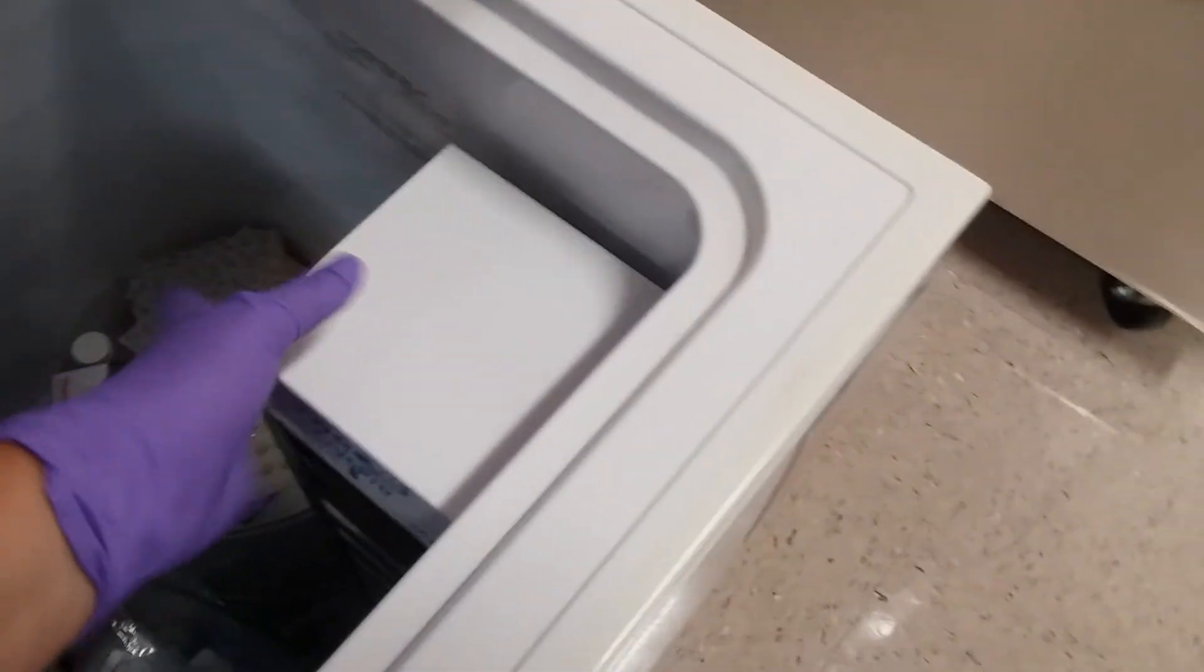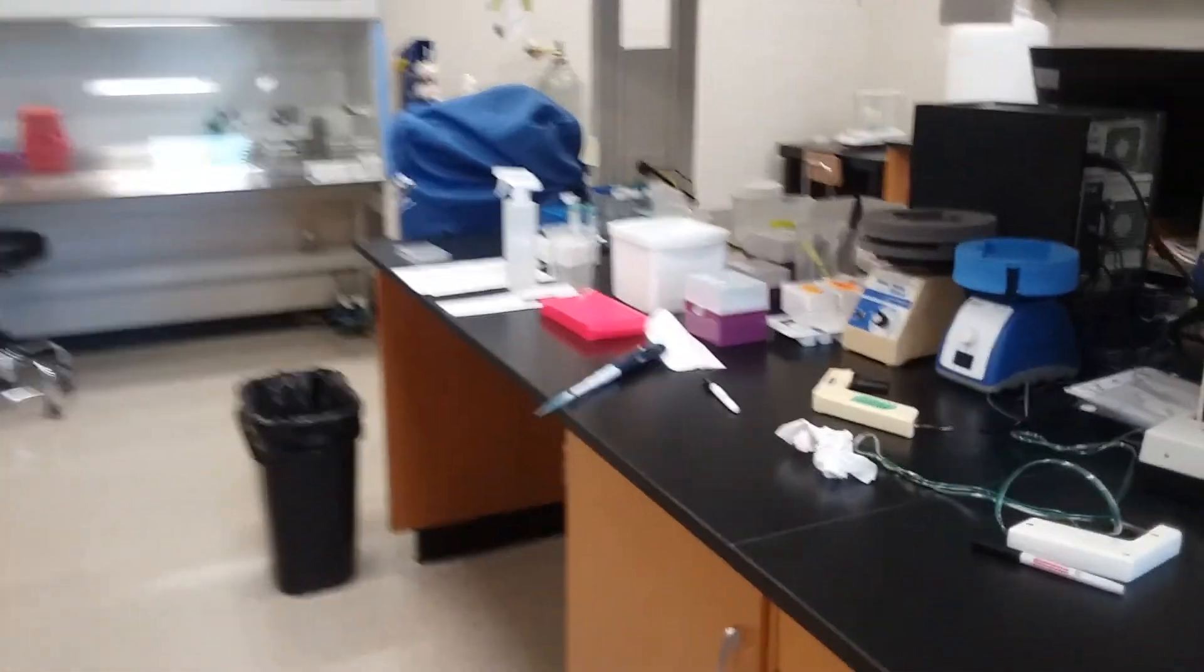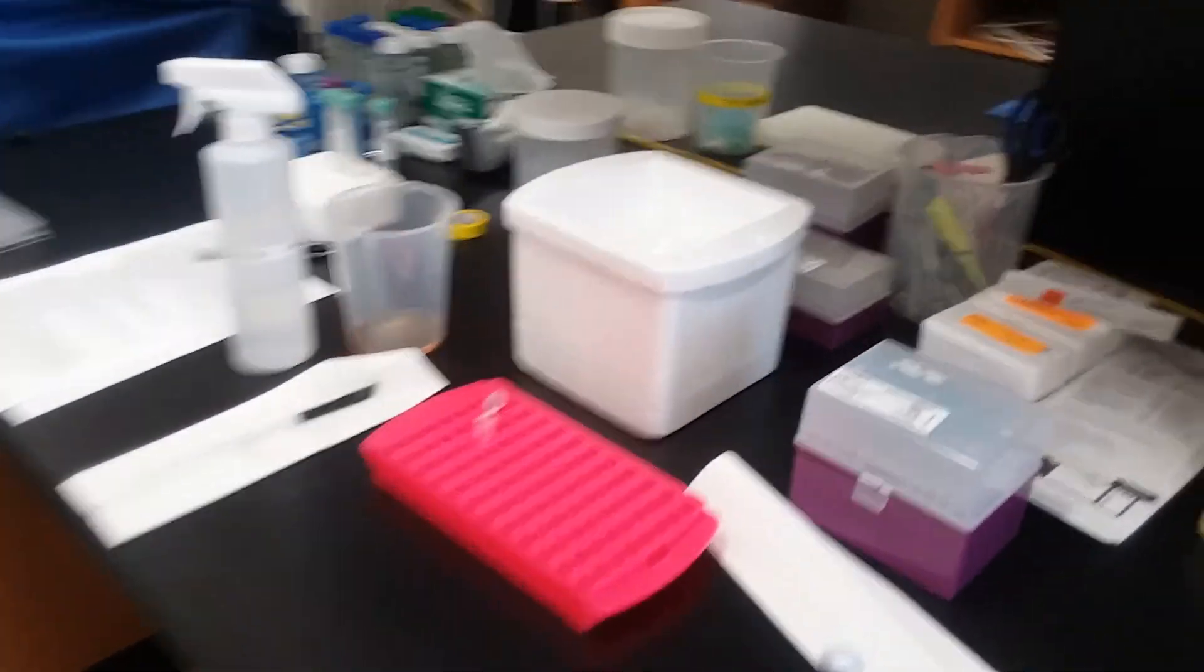Hello people, I have a storage box. And I'll put that whole cell lysate into my storage box and I will take it to my negative 20 degree chest freezer. We want to store this frozen. And there we go. We just made a whole cell lysate. I will clean up my area and I will get ready for protein quantification.